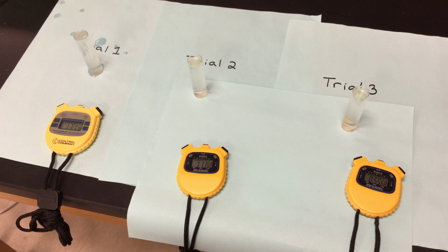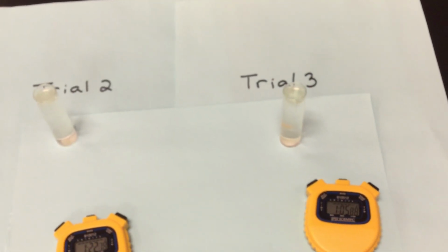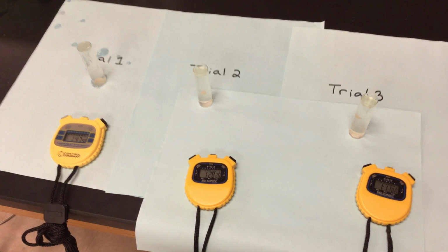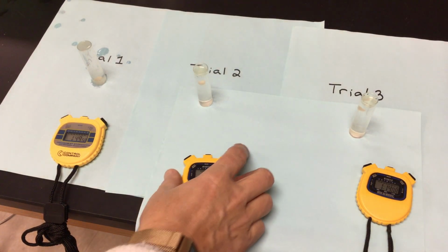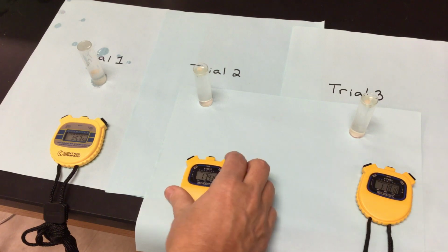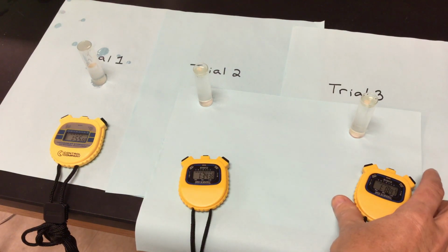We want to see what are the effects of my pHs on them. So disc number 3 is actually making its way, kind of stuck in the middle right now. You guys can see that right there. My other 2 are just kind of hanging out as well, not really going too far. Disc number 2 is making its way up to the top. Disc number 3, disc 2 is there. Disc 3 is there. Here comes disc 1.